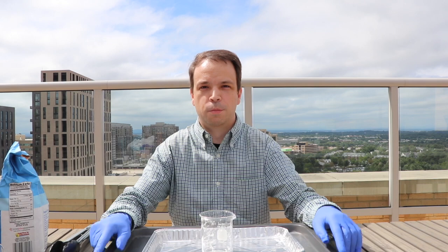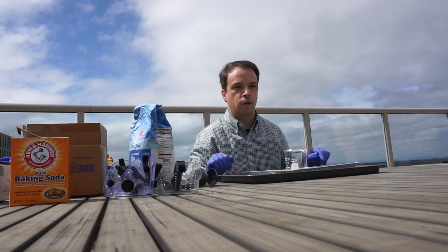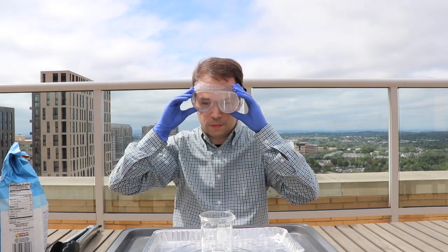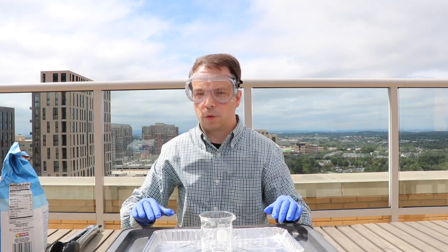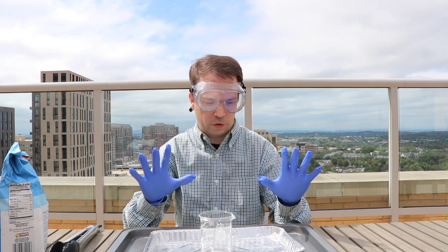Before doing any chemical reaction, you first want to make sure you're practicing the proper safety protocols. So you'll see that I'm wearing gloves today. I'm also going to be wearing goggles as well. Perfect. I'm also wearing a long sleeve shirt. Since we are working with sulfuric acid, it is very corrosive. You definitely do not want to get this on you anywhere. So you want to make sure you wear it safe.